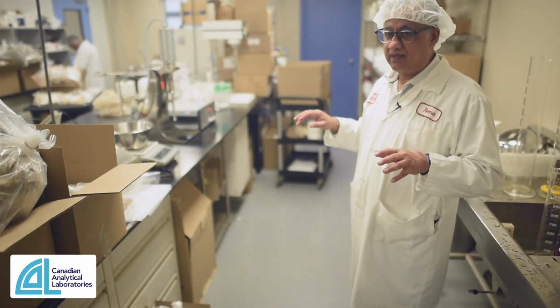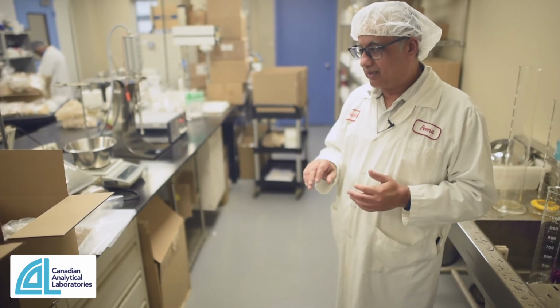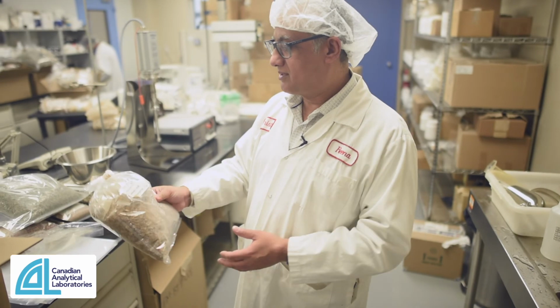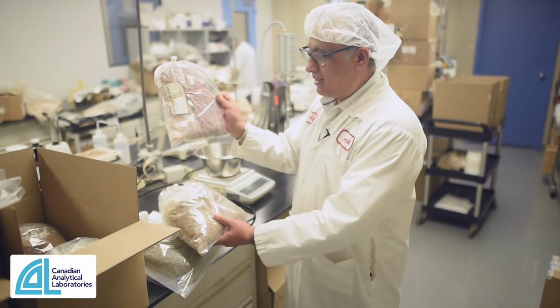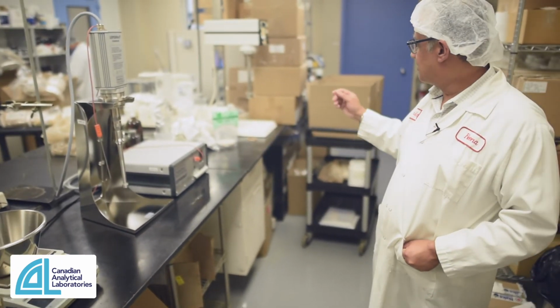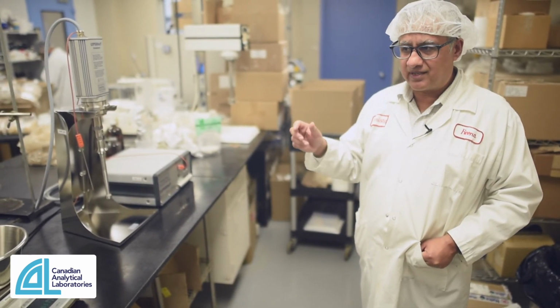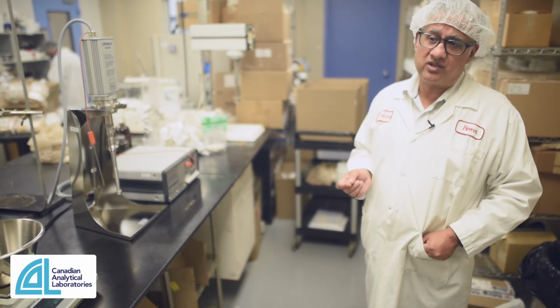So we're in the second part of our R&D activities that we do at Cal. This is a physical lab where we take herbs such as wild garlic and rose petals and things. We take herbs like this and we utilize technologies like ultrasonication and the Silverson to actually develop tinctures and extracts to study constituents of botanicals in a much more detailed way.